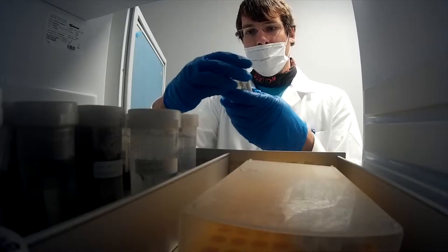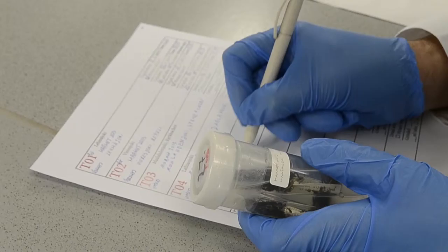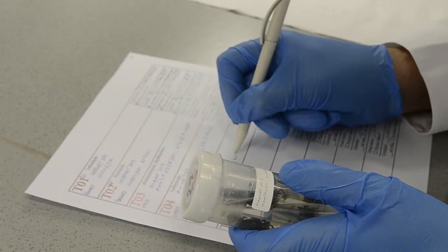However, two-thirds of the samples did work well. All surfaces and equipment were cleaned with ethanol before starting the extraction to prevent cross-contamination. The sample ID was checked and also the things written on the tube were protocoled to avoid sample confusion.